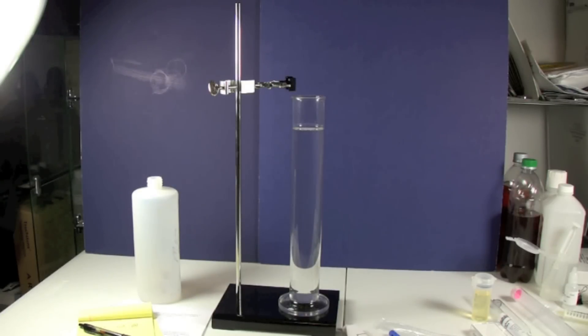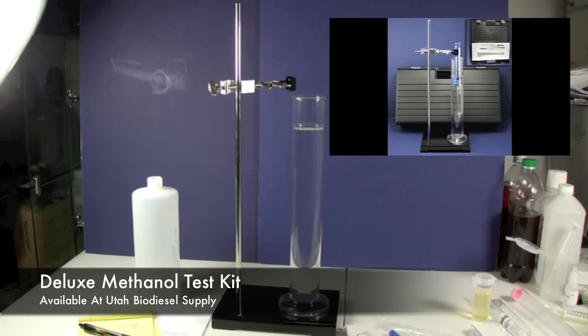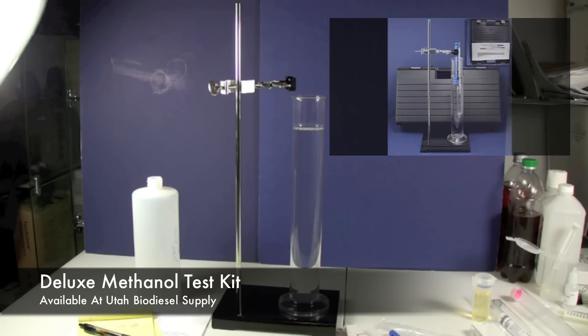We're going to conduct a methanol test to see what methanol's purity is today. We're using our deluxe methanol test kit with the stand which comes with the ultimate methanol test kit.